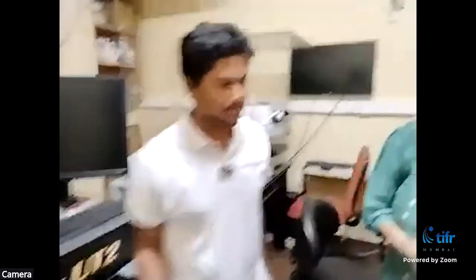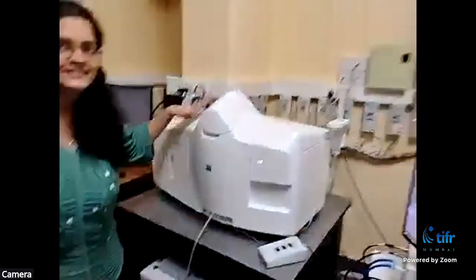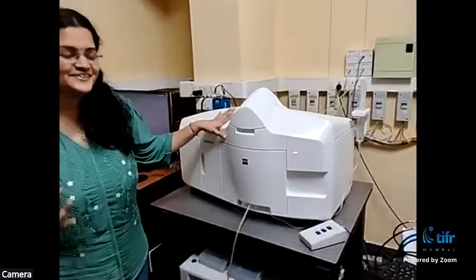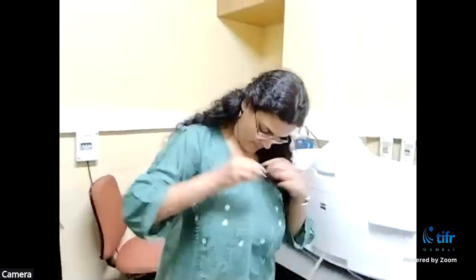Okay. So you have lots of microscopes here. Yeah, we have 3 microscopes in this room. This is a confocal multiphoton microscope. But you're not going to show us this instrument, or that one either. You're going to show us this one. Yeah, this is the microscope that we work with a lot in our lab. This is called a light sheet microscope. I'll explain why it is called a light sheet microscope in just 1 minute.